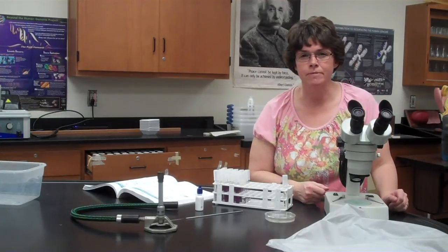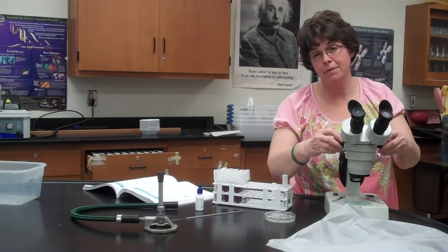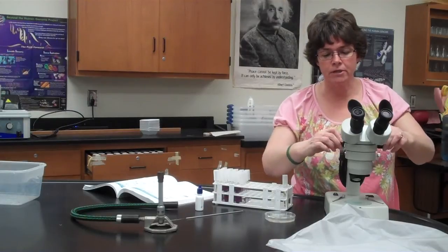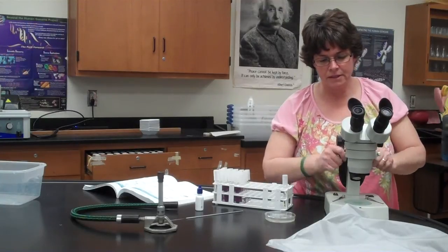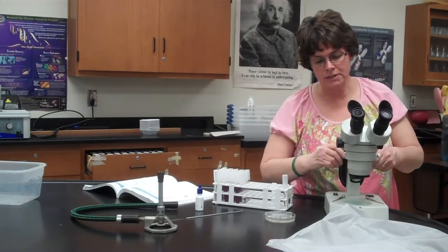This does not have the two different sets of lenses like we see with a compound microscope. It basically has the ocular lens. And then these knobs right here are kind of like coarse adjustment, but it will make it closer and further away, okay? Let me rephrase that. It'll make it look bigger and smaller. This is the coarse adjustment here. And so you basically can see as I move this, it's moving the entire body tube. And so you're going to get closer or focus in and out.